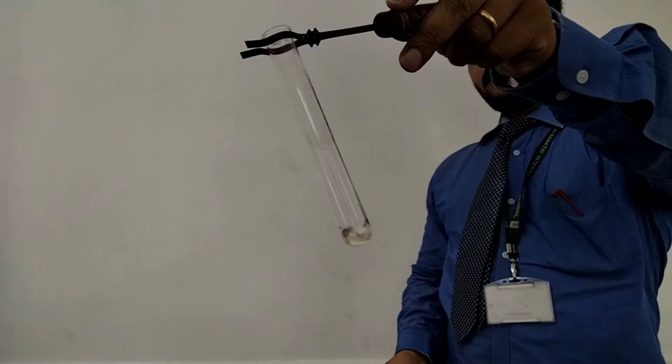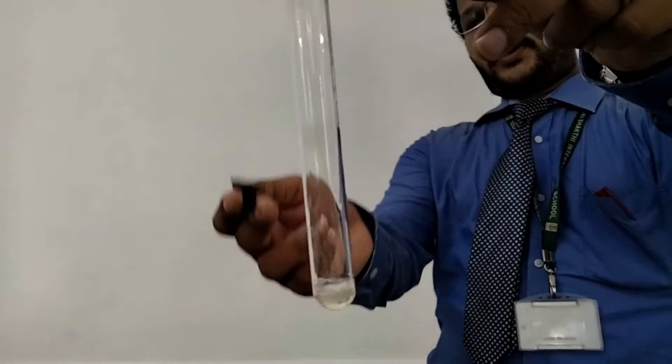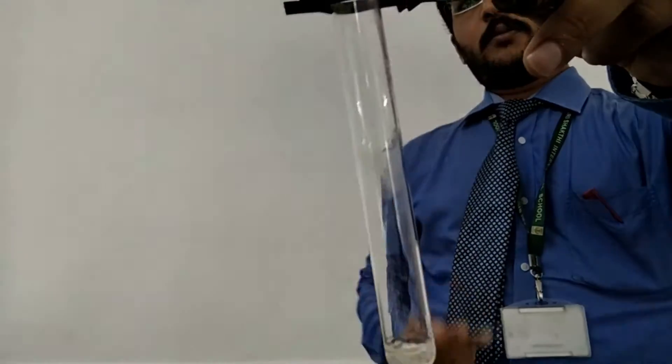The effervescence is due to the release of hydrogen and we can find the hydrogen gas is coming out from this.